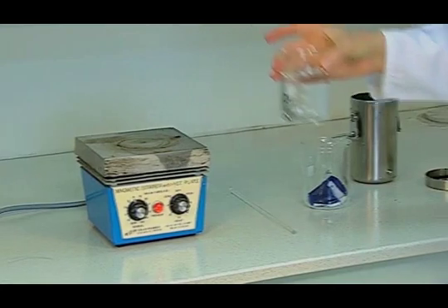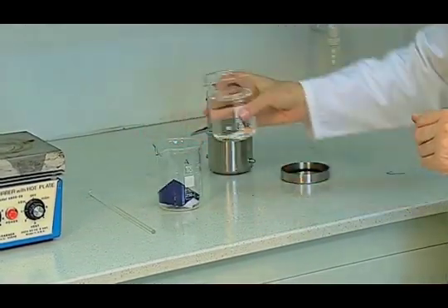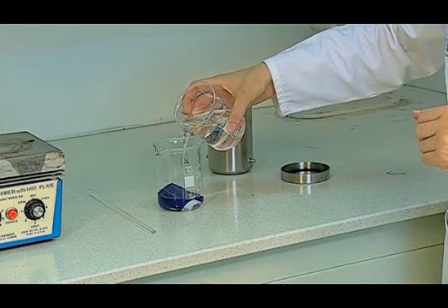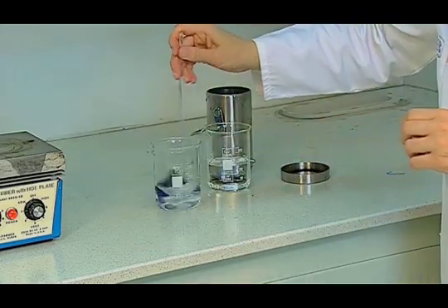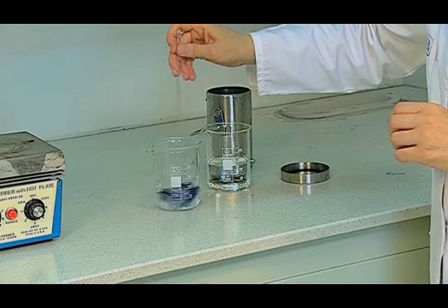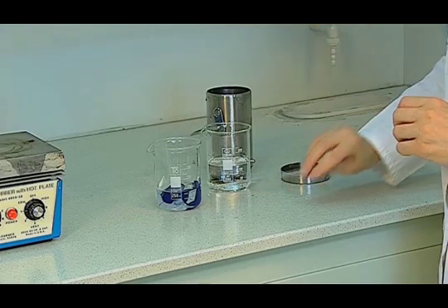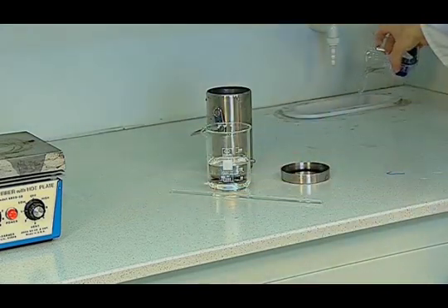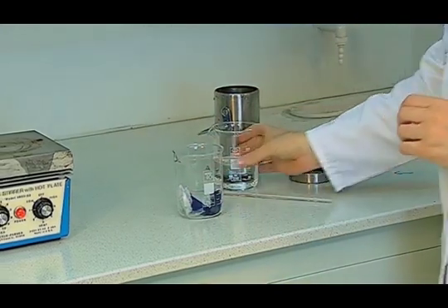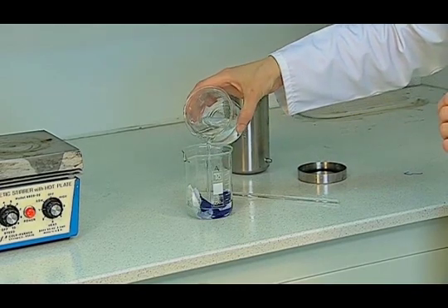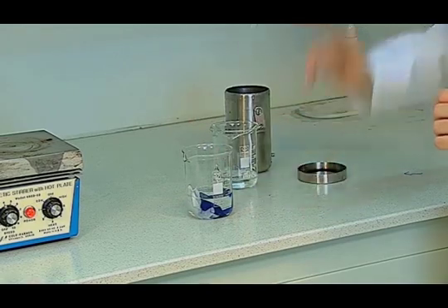Pure water, heated to 40 degrees centigrade, is used to wash off the sample with 100 milliliters of pure water at 1 minute intervals. At the second wash off, the sample is mixed again with 100 milliliters of pure water for 1 minute.